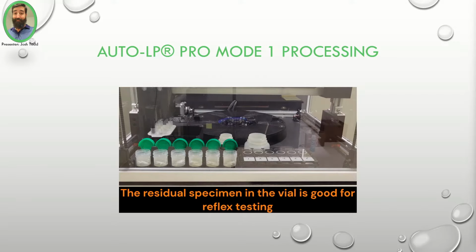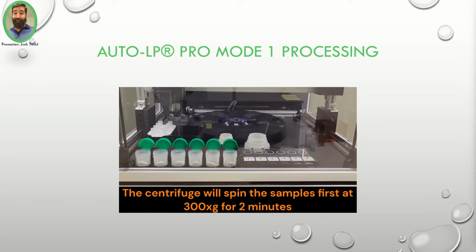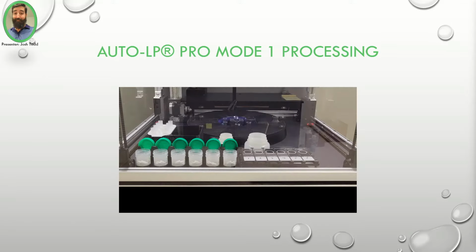Residual specimen left over in the vial is good for reflex testing. Ensure to cap your specimen after your processing run. The centrifuge will then spin the specimens first at 300 times G for 2 minutes in our slow centrifugation run. After centrifugation, the supernate is removed from each centrifuge tube.